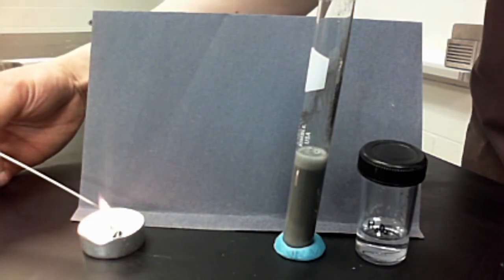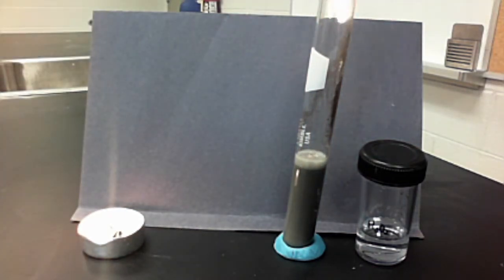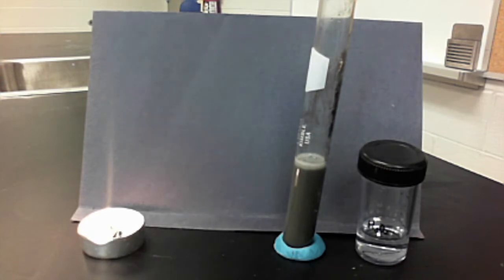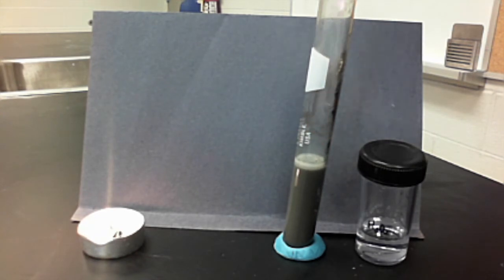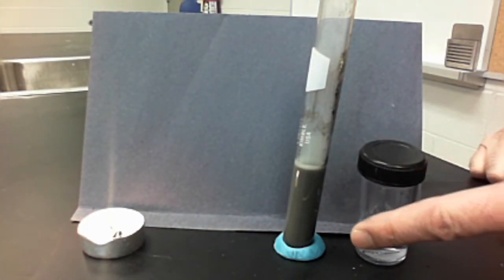In this case it's causing things to break apart. It's producing an invisible gas — we can't see what it is. If I have a lit flame in here, nothing special happens, so it's definitely not hydrogen. But if I smother out the flame and have a glowing splint and place it into this gas, you'll see that it reignites the splint over and over again. Ignore the pop sound — the flame is just excited to be reignited. What we're focusing on is that the gas being produced is enough to cause a glowing splint to reignite.